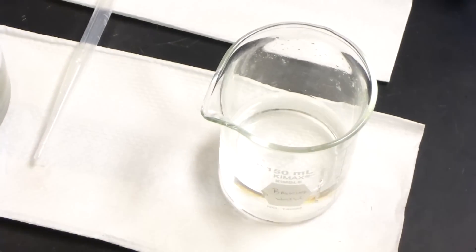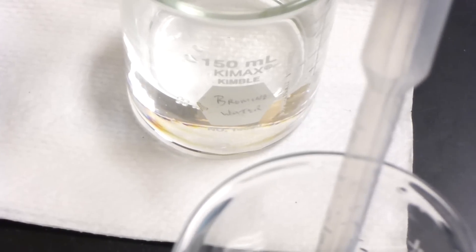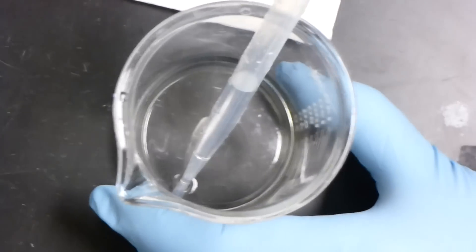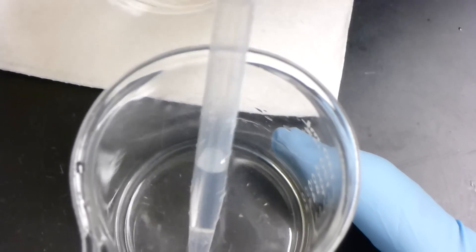Do you see anything? I don't see anything. A few bubbles, just a few. They're on the bottom. Putting more in just makes it jump to the top. I think it's good.